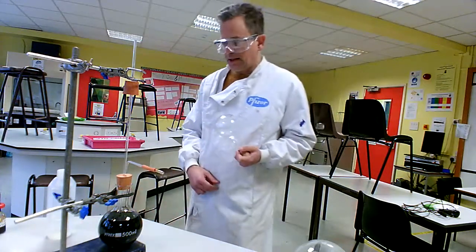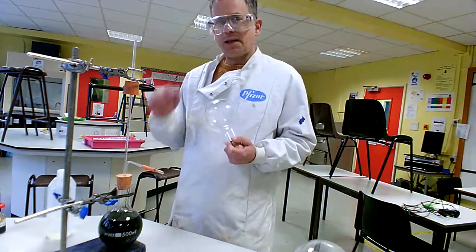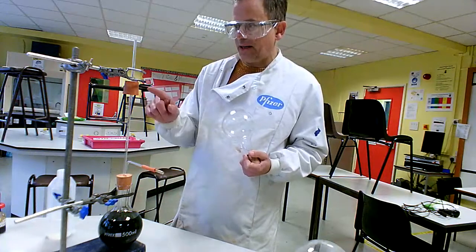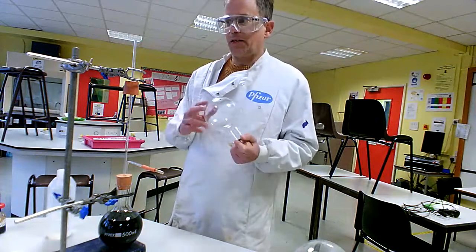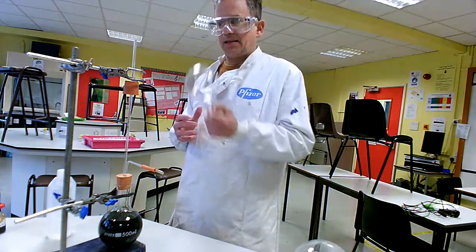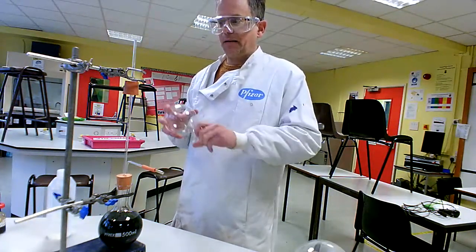This flask contains water and universal indicator solution — quite a lot of universal indicator, so it looks quite dark. This contraption is a two-hole bung, with one end open to the atmosphere and the other end has a bung at the top. I'm going to put this flask onto the top. You might see some white fumes escaping from the flask as I put it on — in fact I hope we do, because that would be a good sign that we have plenty of hydrogen chloride in the flask.